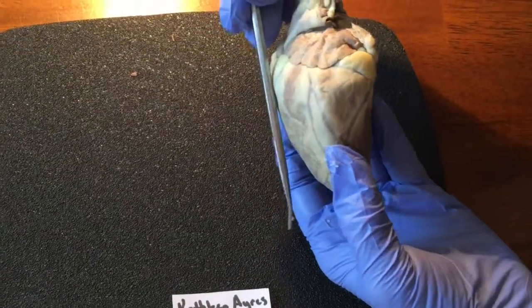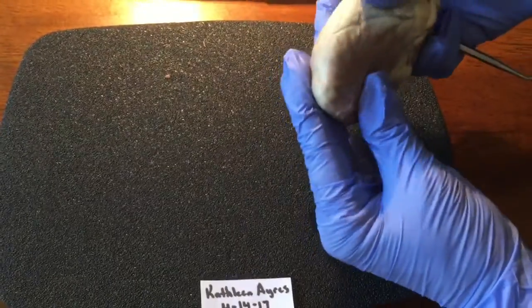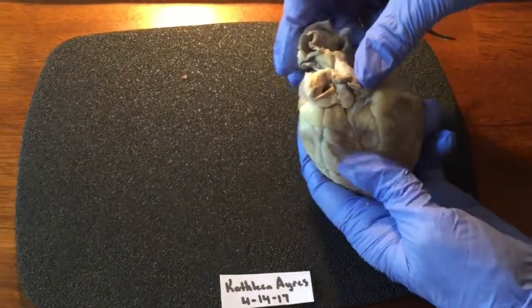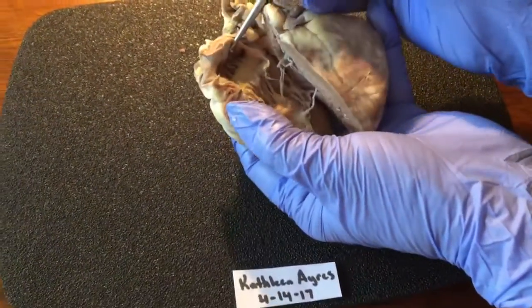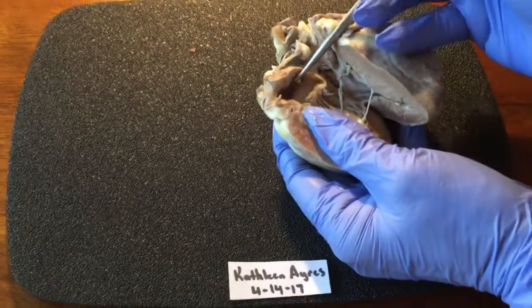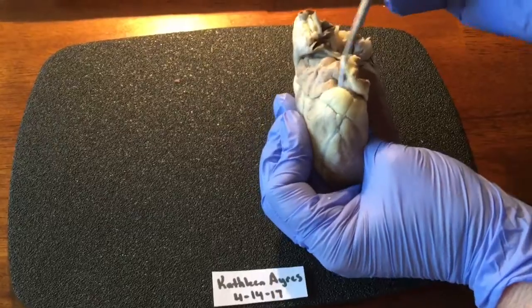They should be here. And I don't see anything coming into or out of the heart. So I'm going to move on to the next. The coronary sinus here. Somewhere the superior vena cava and the inferior vena cava run through this, and I'm still not able to.